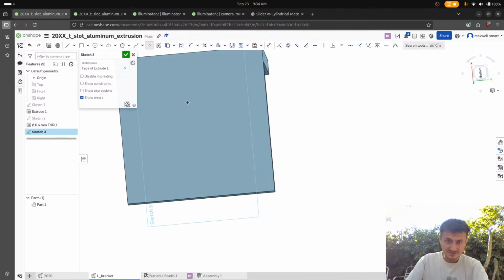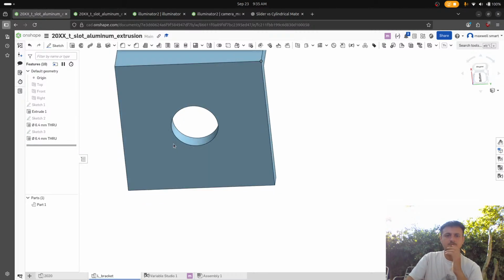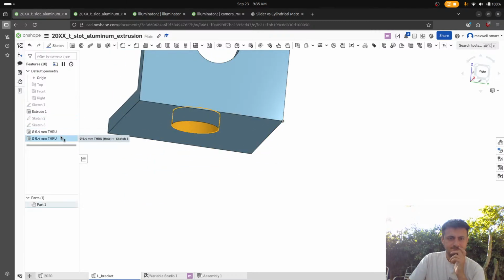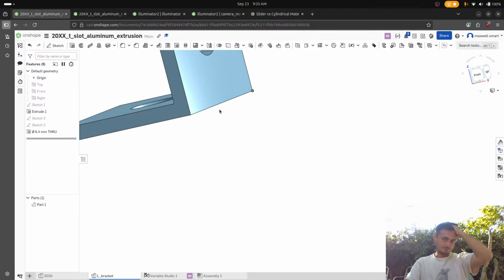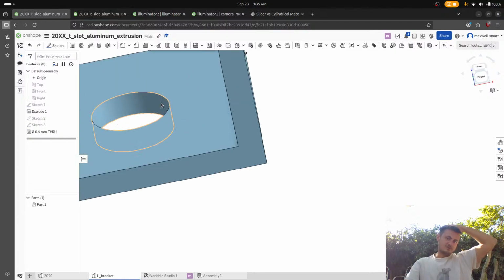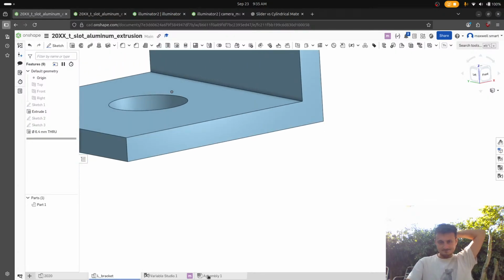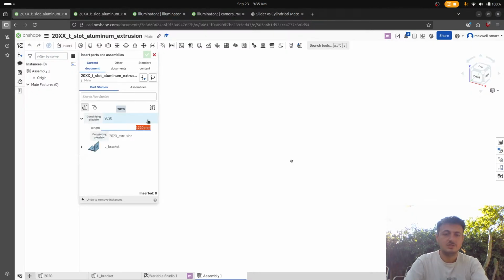I always think P is for point, but it's not. Or actually, wait, can I do this? Oh, it's also for collisions, because I think that if you were to, no, what? 1220.